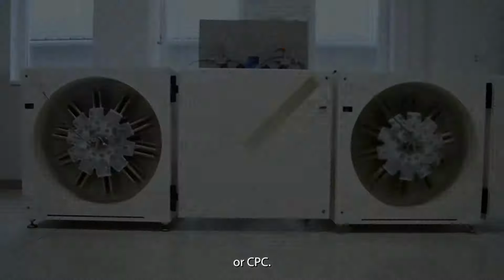CPC is a liquid-liquid preparative chromatographic technique, in which separation occurs between two immiscible liquid solvent systems, acting as both the stationary and mobile phases. Separation of the injected sample is based on the sample components' varying partition coefficients between the mobile and stationary phases. Partition coefficient, KD, is the equilibrium constant for the distribution of a compound in a two-phase system.